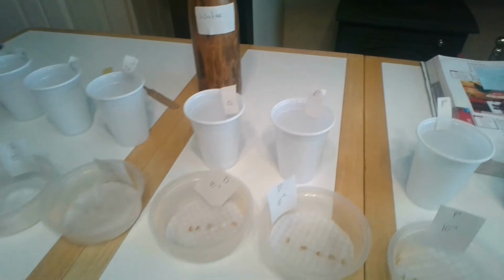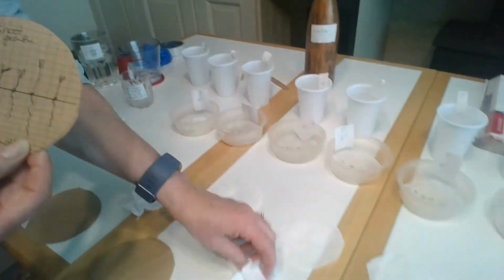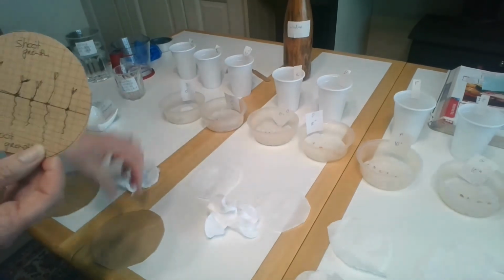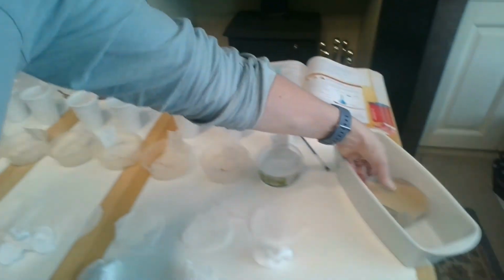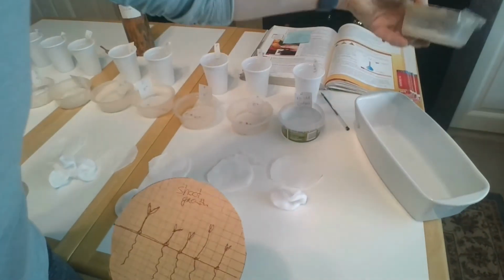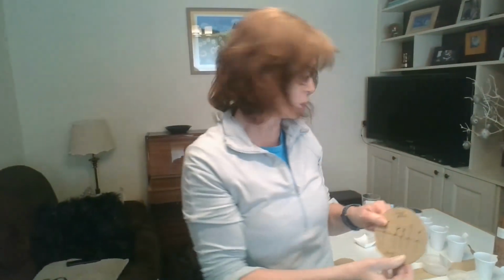You've got to explain why there is acetate, why you have filter paper, why you have cotton wool, and you might need to explain how you put your lid on and how you seal it and how you place it horizontally in some kind of a container to keep them horizontal, and know it's 2 to 3 days that you let the seeds germinate.